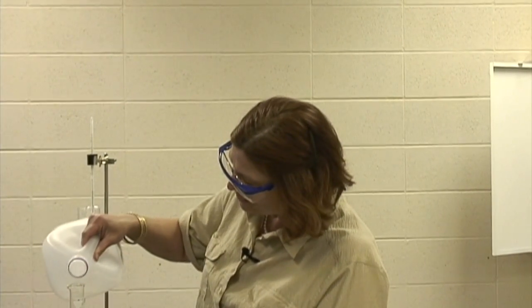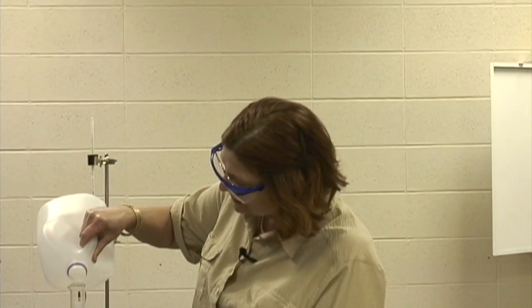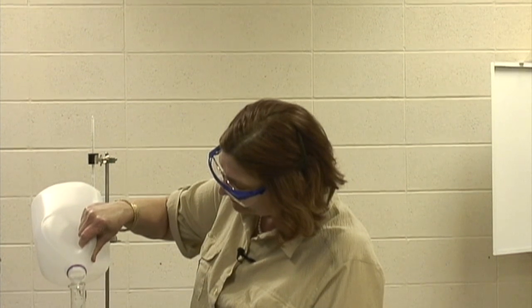Well, here we are at my favorite place, getting ready to use that old Bunsen burner. Well, first I need to measure out 50 milliliters of distilled water. And actually, the volume that I'm going to use to boil is not critical, but I am going to still, for scientific method, use the same amount of each one. I will pour it into my graduated cylinder here to get 50 milliliters.